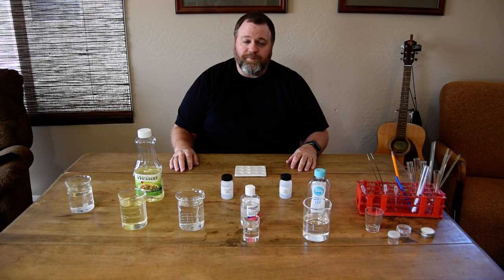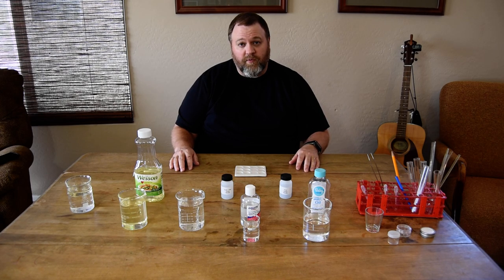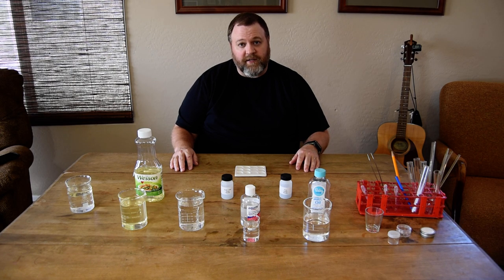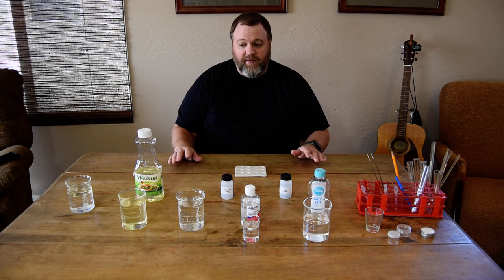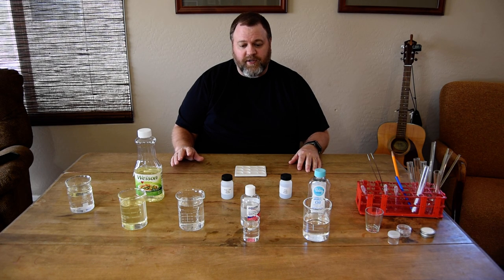Alright folks, so for this video I'm going to go over the procedures you're going to follow to compare glass using different liquids of different refractive indices. In our previous video, I explained what refractive index is and how we can use the concept of refractive index to compare glass, and then we're going to put that to practice for our lab exercise.